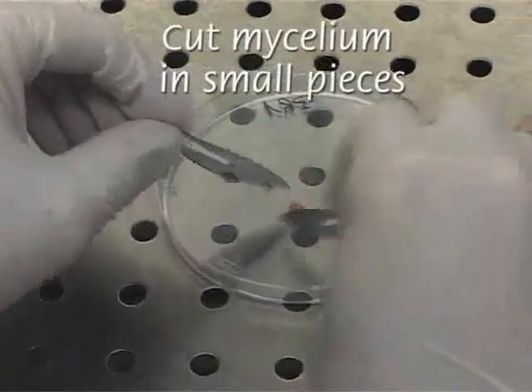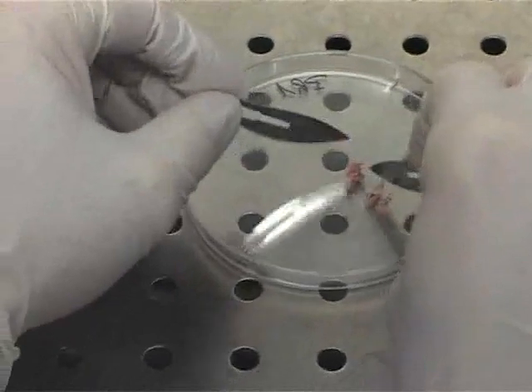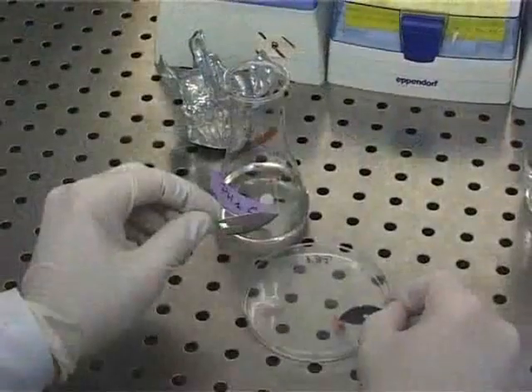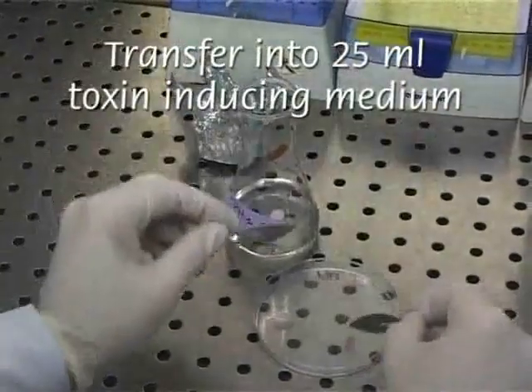Mycelium is cut into 5 small pieces and added to an Erlenmeyer flask containing 25 ml of toxin-inducing media.